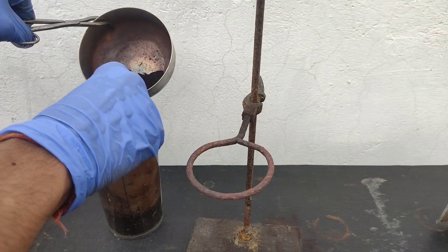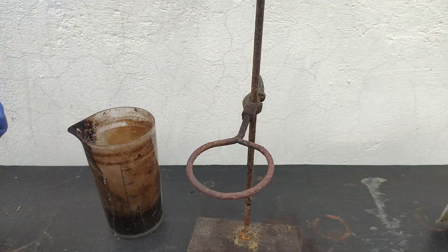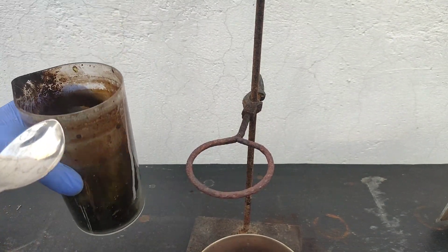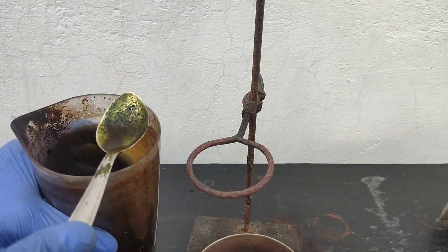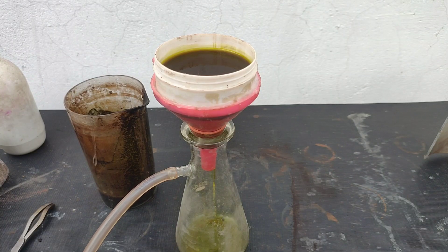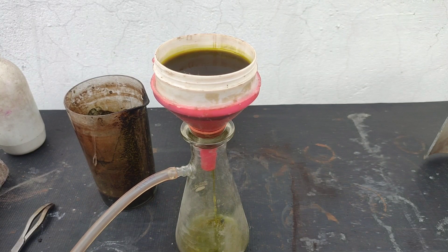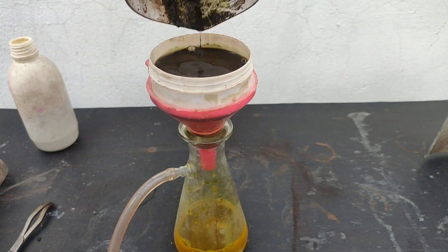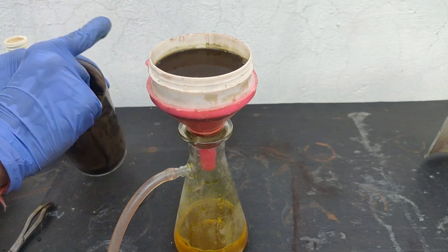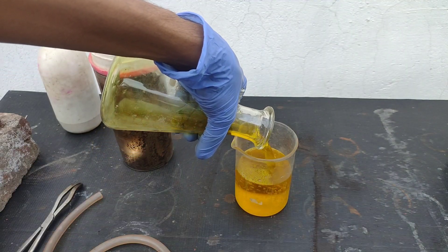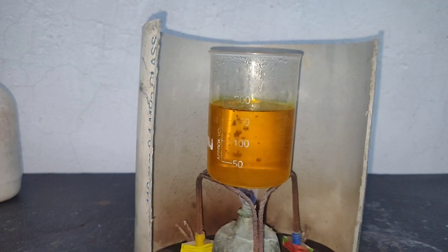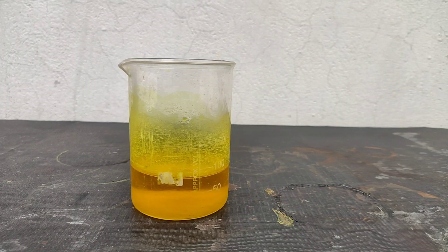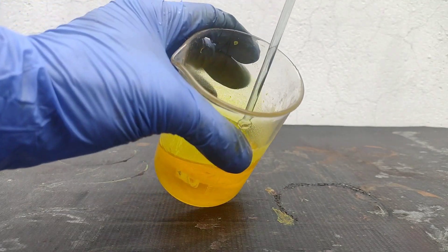I took this powder, added it to 100 ml water and stirred it for some time. We see some yellow color. I filtered this off using vacuum filtration and yes we got some yellow chromate. I washed the precipitate several times until the filtrate started coming colorless. Then I poured the solution into a 250 ml beaker and concentrated the solution to less than around 100 ml. On cooling some crystals were formed but I doubt if they were of chromate.